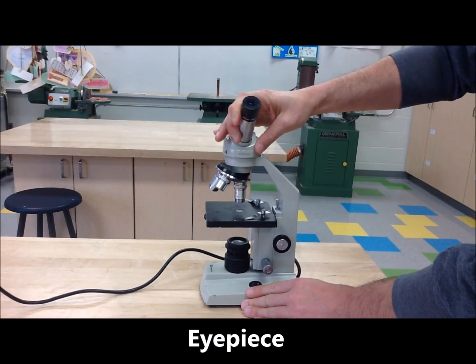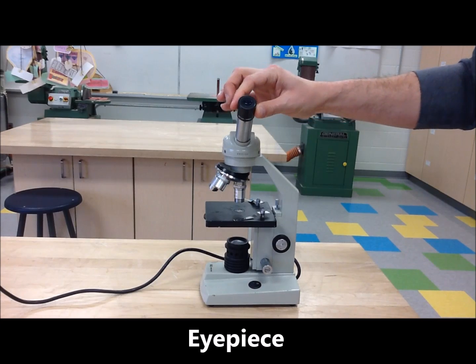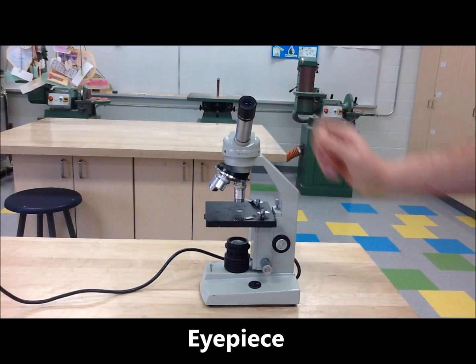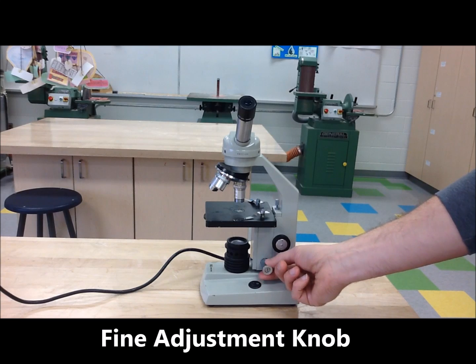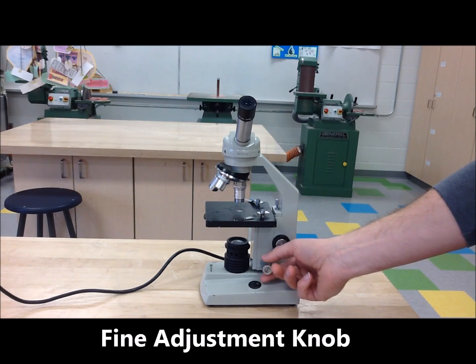Eye Piece. Lets you look into the microscope and makes the image ten times bigger. Fine Adjustment Knob. Sharpens the image to make it more clear.